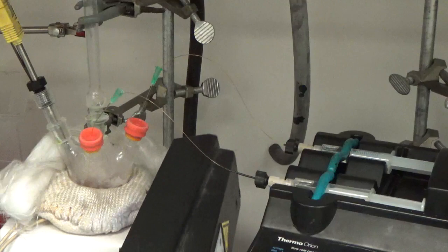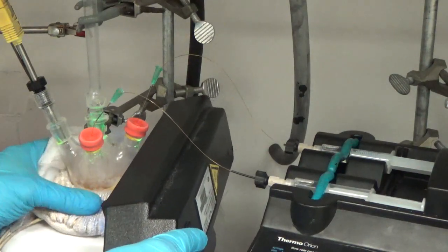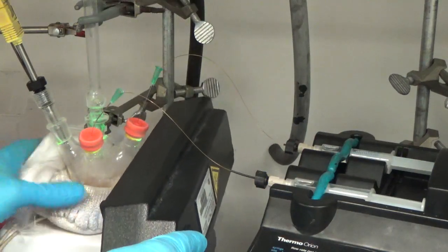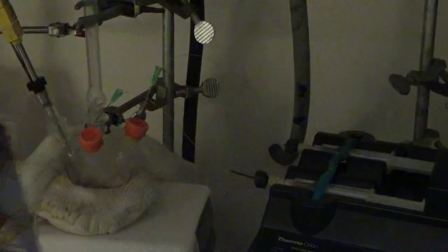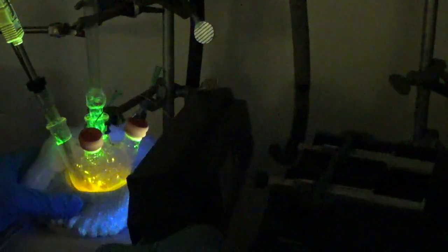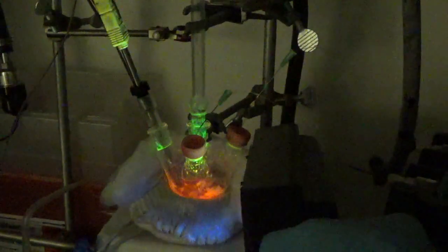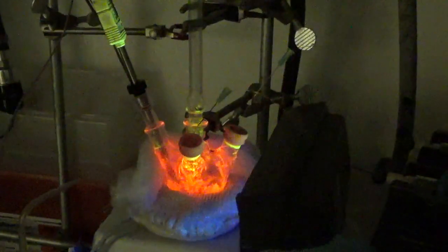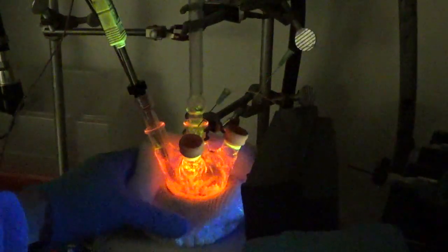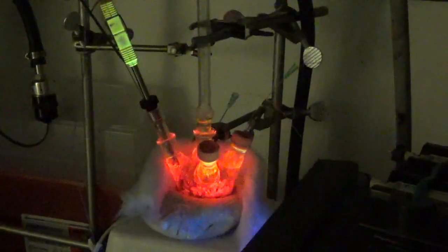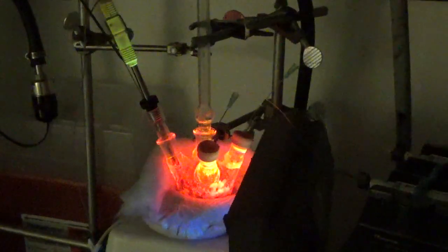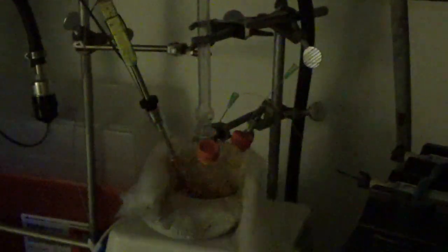You can see that better here. If I'm overcoating small QDs, I'm going to be injecting at first around 160-180°C. Small dots are sensitive and you can't overcoat them very hot. But as they get bigger and bigger - you notice that they're red-shifting as more zinc and sulfur are overcoating them - they're red-shifting. There's a little bit of green residue dots that are stuck on top. You have to be really careful with that. If they get stuck up there, just make sure they stay there or try to heat gun them down. You notice the dots are red-shifting bit by bit. As the dots red-shift, meaning they're getting bigger, I will raise the temperature up to maybe 220-240°C. This is much lower than what you may have read about, especially if you're using octanethiol as a sulfur precursor. These lower temperatures are okay.